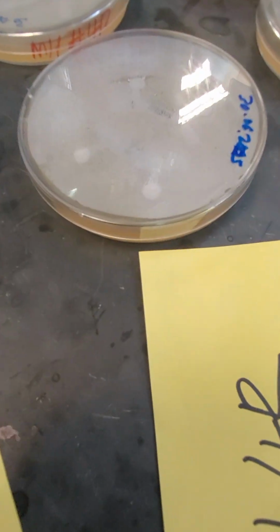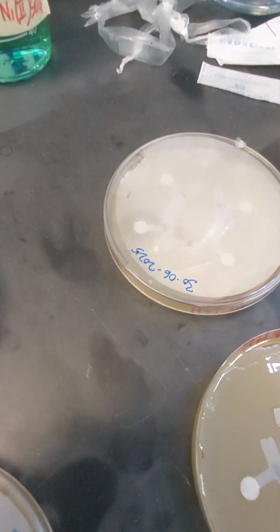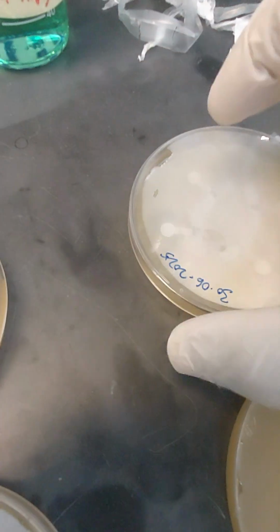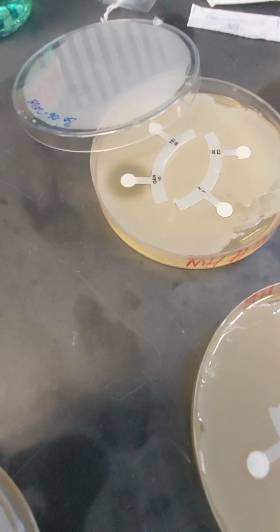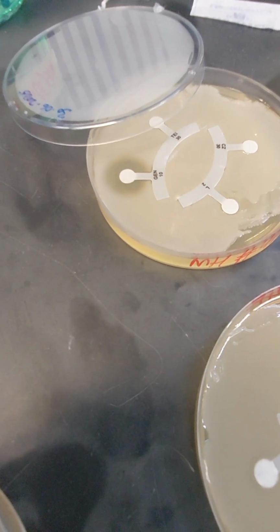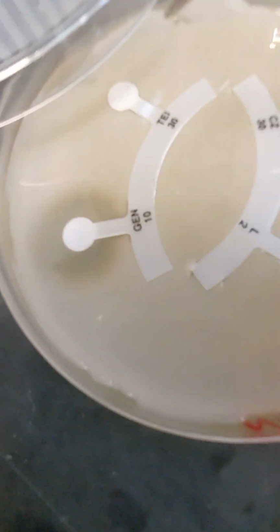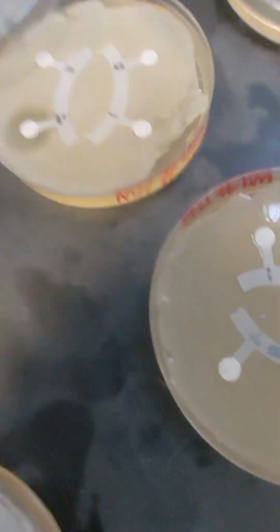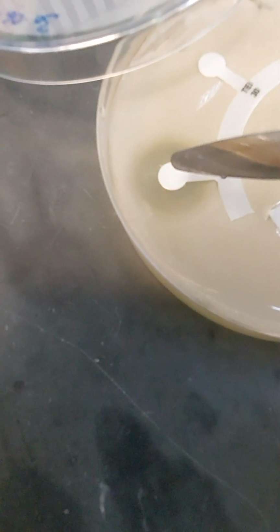Let's look at 4R. Now, the code number 4 is the sample site. R is because this one was red. What's surprising is that at 37 degrees Celsius on Mueller Hinton Agar, it does not show the red characteristics. Now, as a microbiologist, this will tell you additional information about the strain, which I will discuss in another video. Now again, you can see gentamicin, and the rest, almost no inhibition. So gentamicin inhibits the growth. You can see it on the disc here.